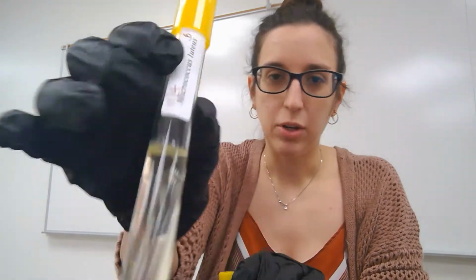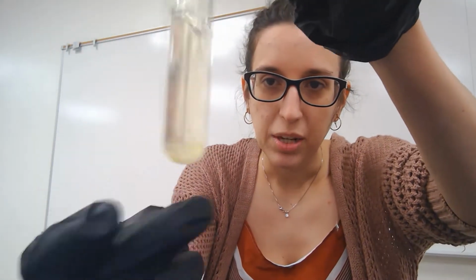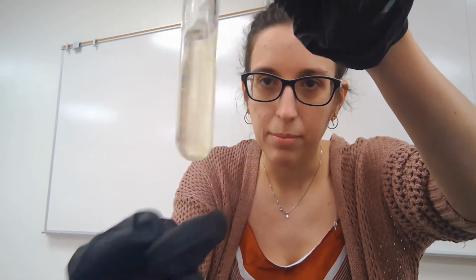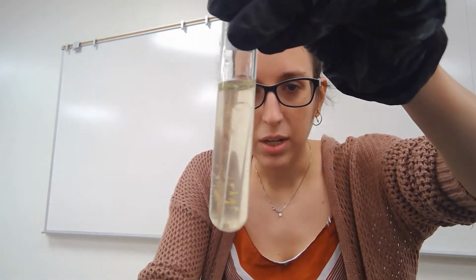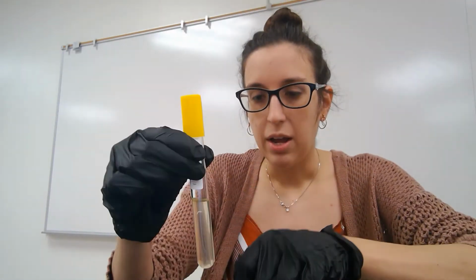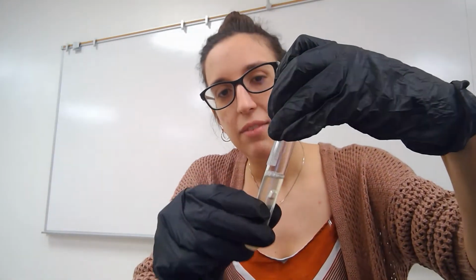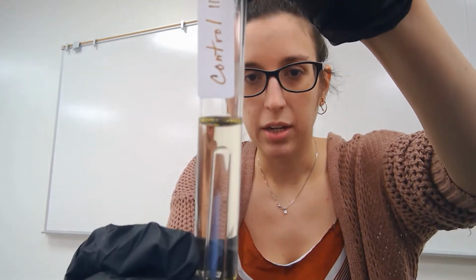And then here we have Micrococcus luteus that is grown here, and you can see as the bacteria grows, it sometimes settles to the bottom, as it sometimes also dies and settles to the bottom, but it's been growing in here, so you see the cloudiness or the flakiness. Here we have some Pseudomonas also grown in this medium. And then here we have a negative control with nothing in it.